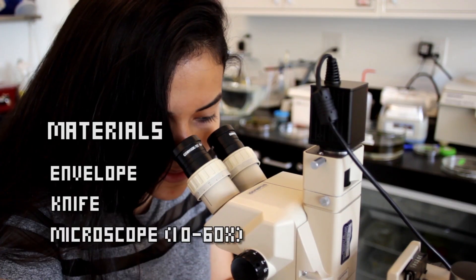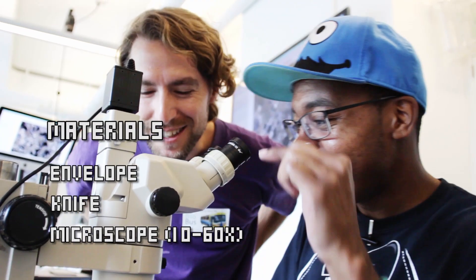To get started you'll need some simple materials: an envelope, a small knife, and a microscope - and the magnification doesn't even have to be crazy.